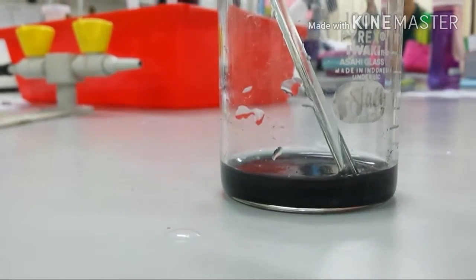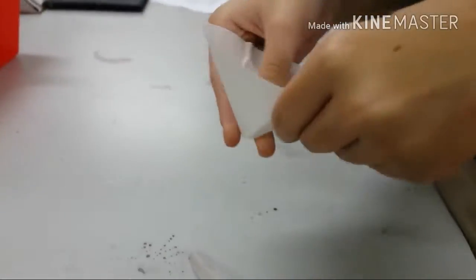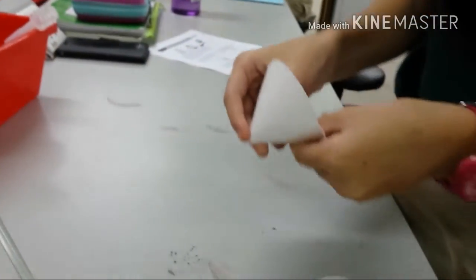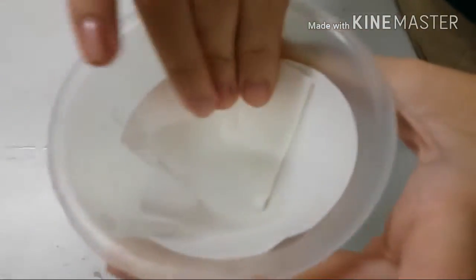Okay, I'm gonna end it here and come back when we're actually starting again. We put in some filter paper. We fold it like that and put it in like that. And then I think we pour it in this, don't we?